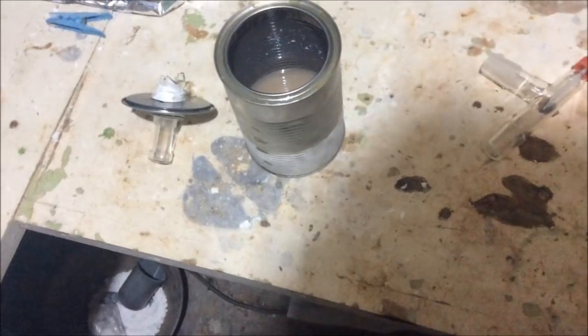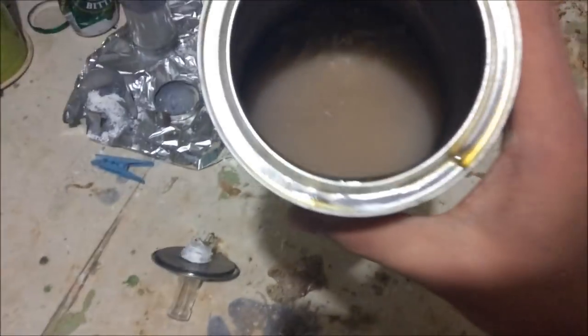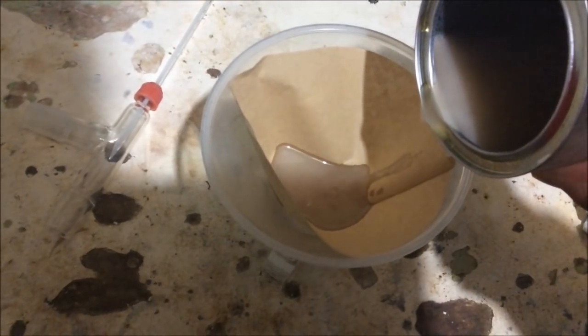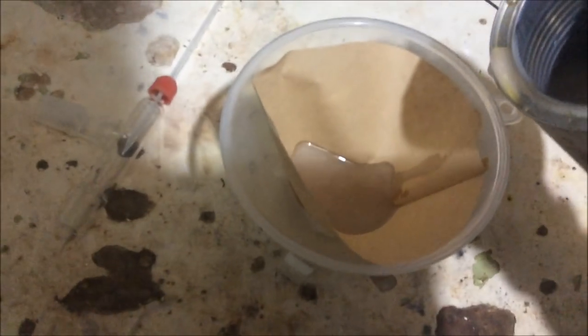This is no good. Alright, seeing as we're struggling to distill the ethylene glycol directly out of the mix, what we're going to do is instead just filter out the sodium terephthalate in there, and then deal with it all separately. Now, you may have asked, why didn't I just do this originally? Why didn't I just separate the ethylene glycol from the sodium terephthalate originally?